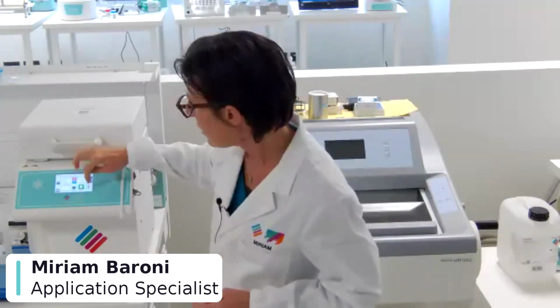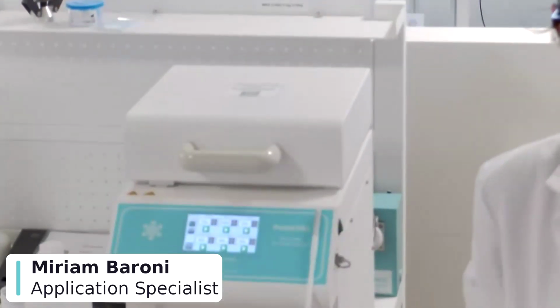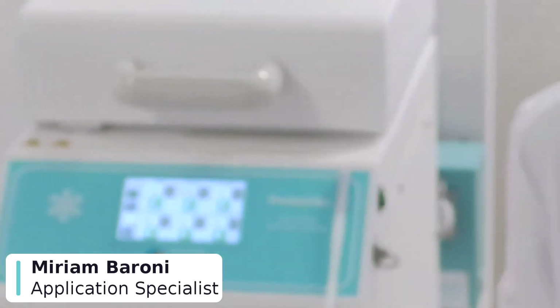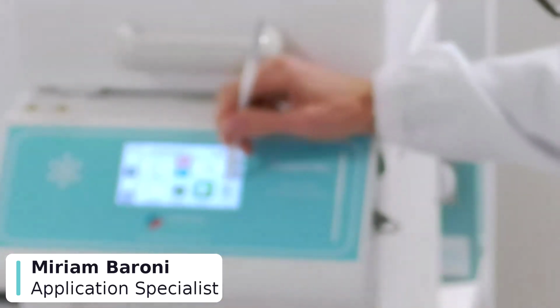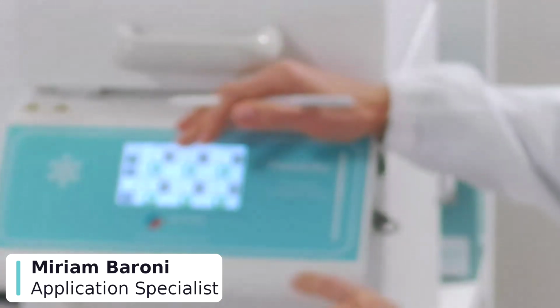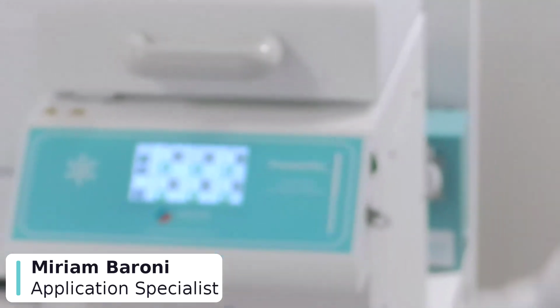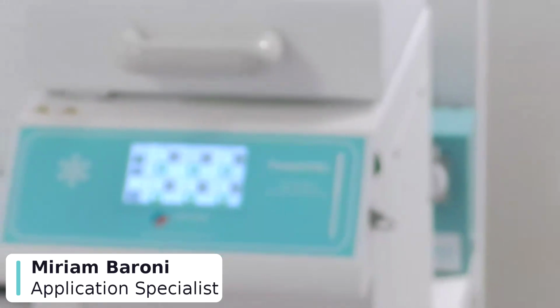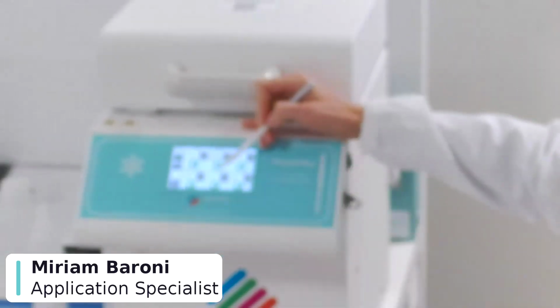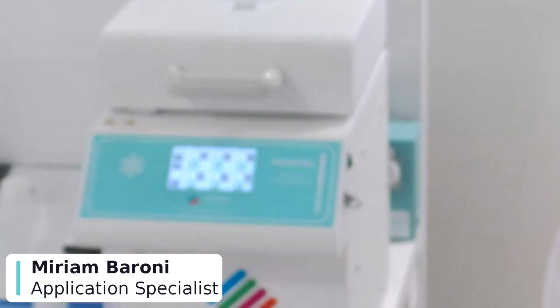In the Presto Chill screen, maybe I zoom in a little bit, just to show you better. Okay, in the main screen, we have this icon that allows to open the camera. Sorry, it's not focused. Maybe less zoom. I'm sorry that I can't show you the image very well.